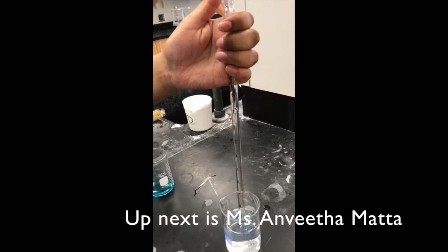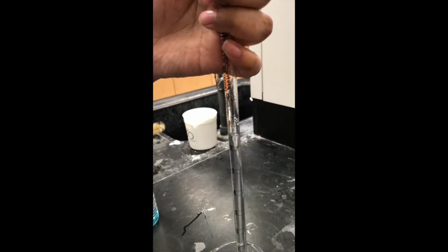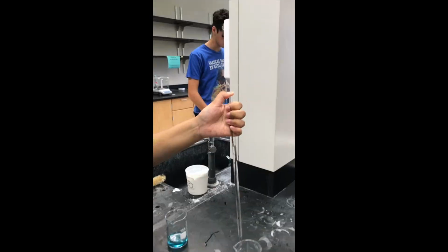In this section of the video, a solution of a weaker concentration is made using a larger quantity of water and a smaller quantity of the blue liquid.